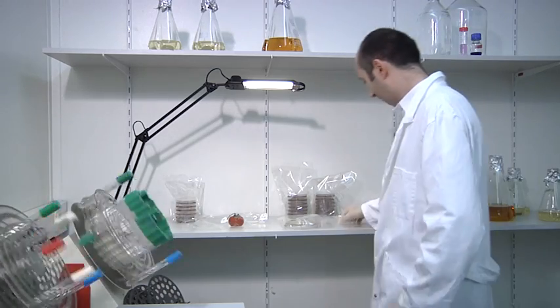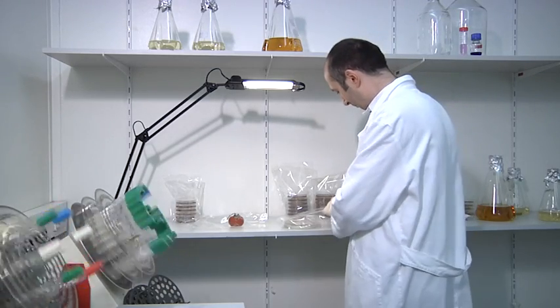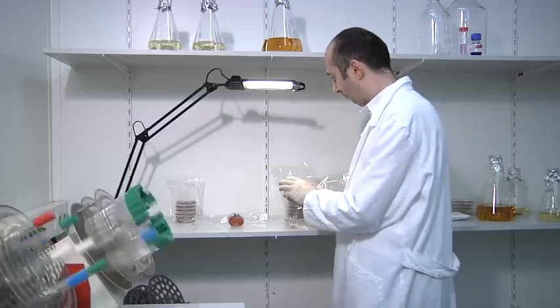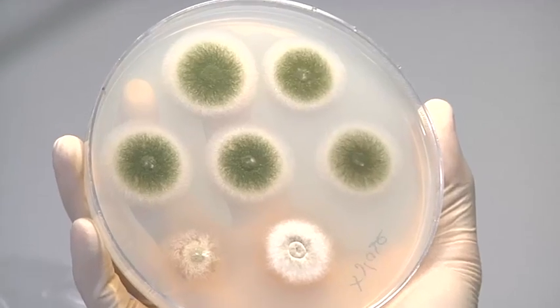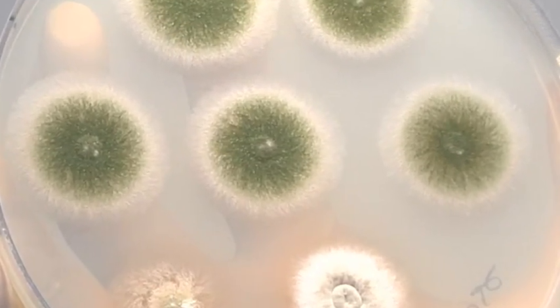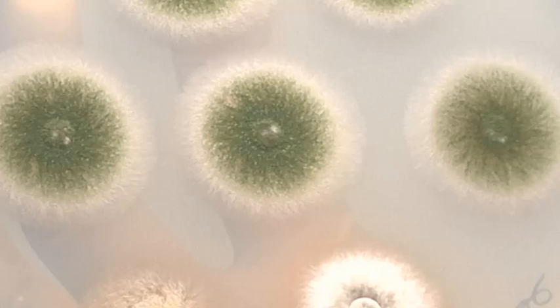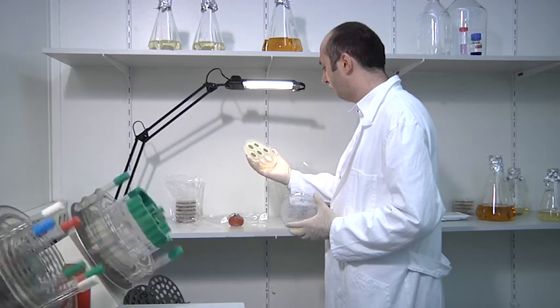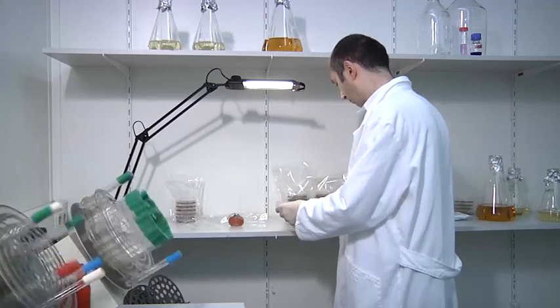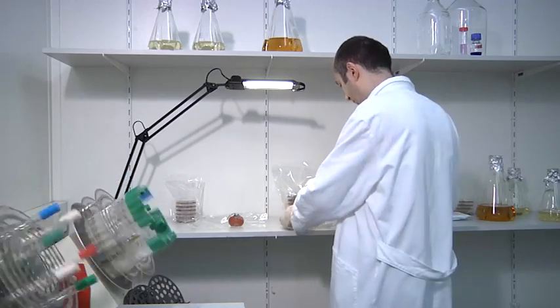In the lab, Aspergillus is a very good model organism. Here you can see some Aspergillus cultures growing on an agar plate. This plate supplies the fungus with basic nutrients, such as carbon and nitrogen sources, from which it can synthesize complex molecules, including proteins, lipids, carbohydrates, nucleic acids, DNA, and RNA.